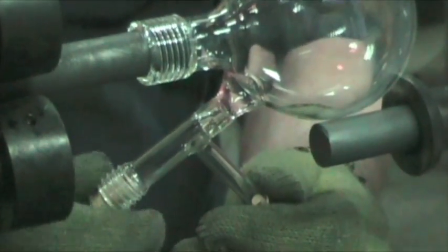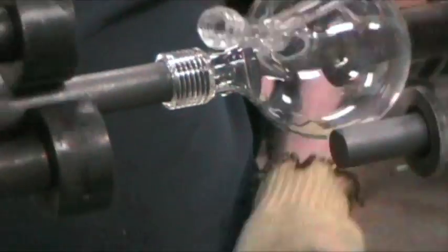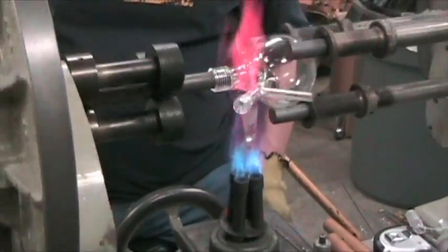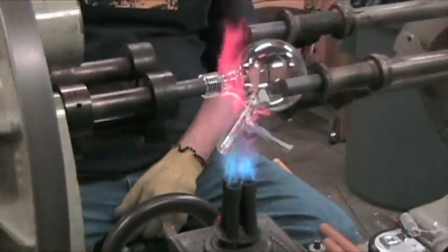Okay, now I've got it attached with a lot of stress spread around right in this area here where I've been working both of these. So I'll kind of cover it with flame a bit and stress release some of it, equalize the pressure through here so it doesn't fall apart on me when I cool it down.